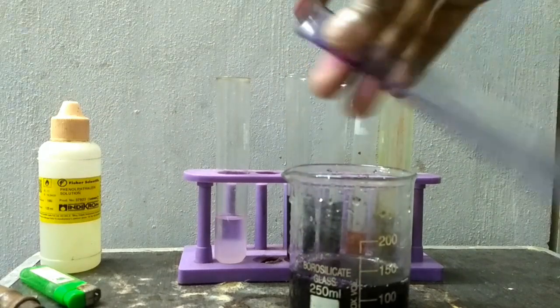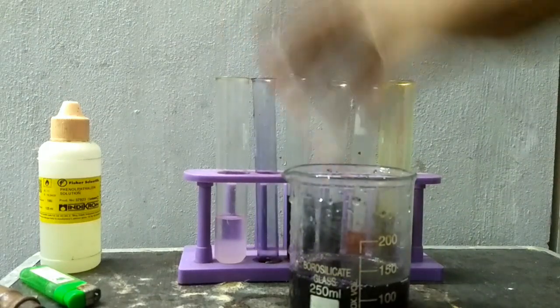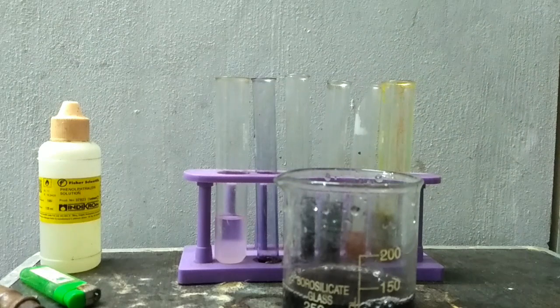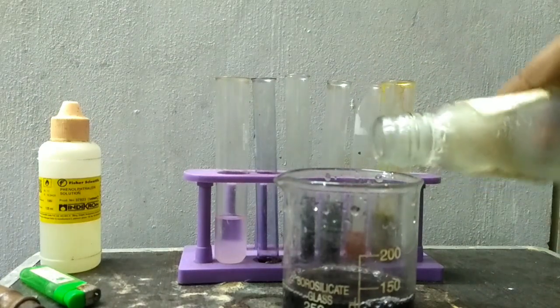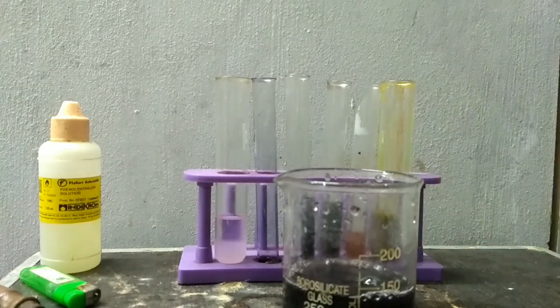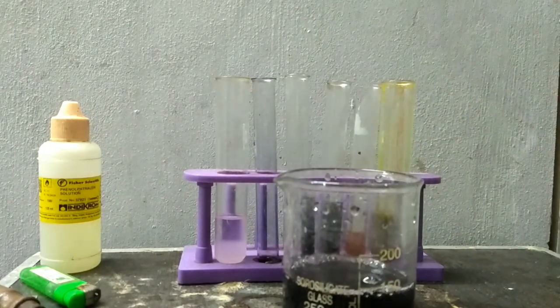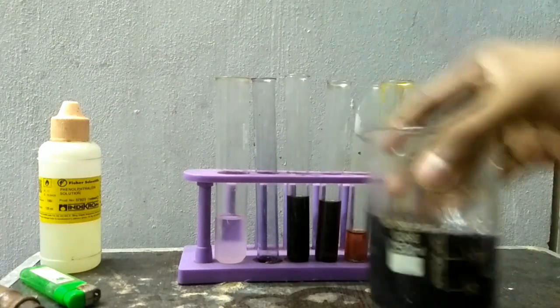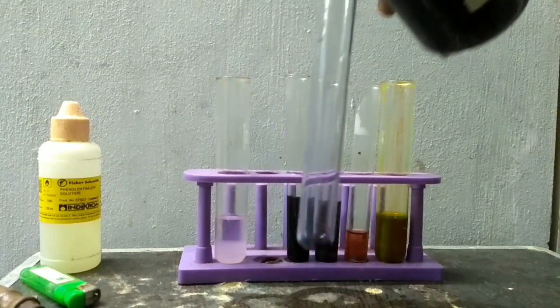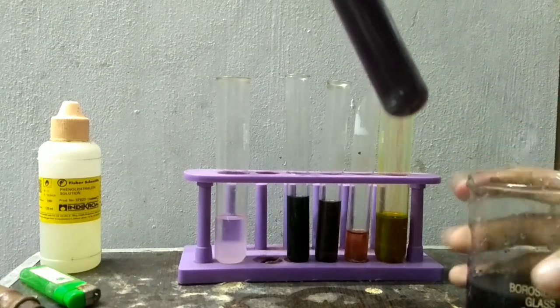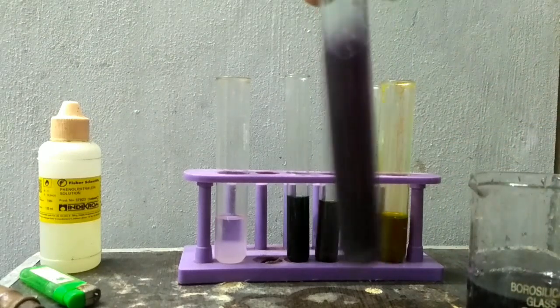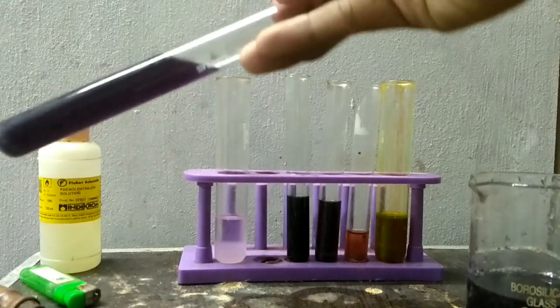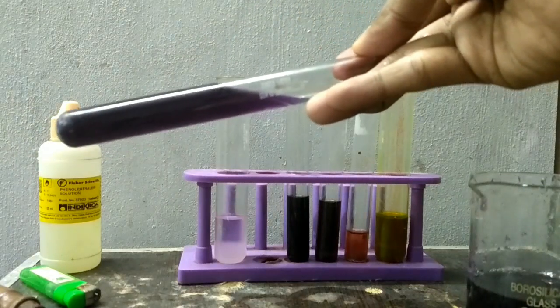Let's pour all the solution. I am adding more NaOH. Now observe its color. Can you see the violet color?